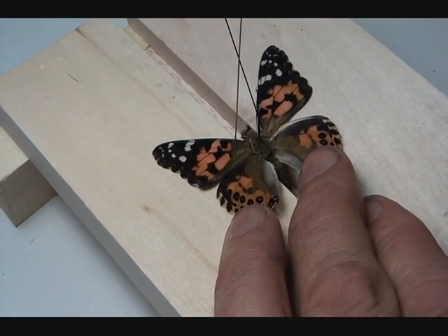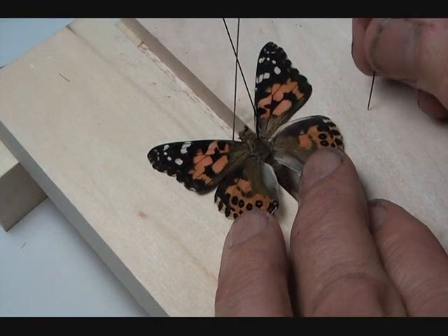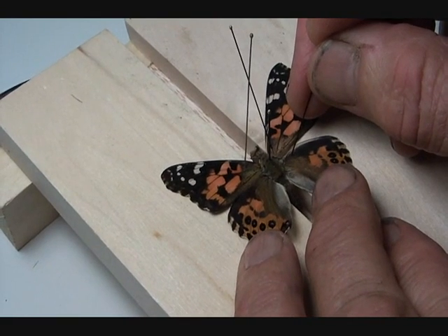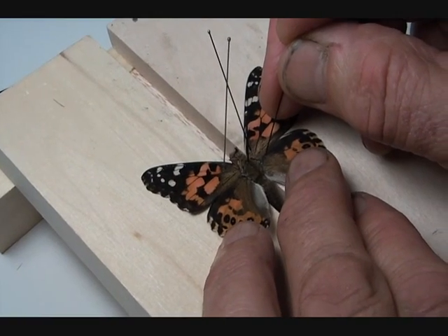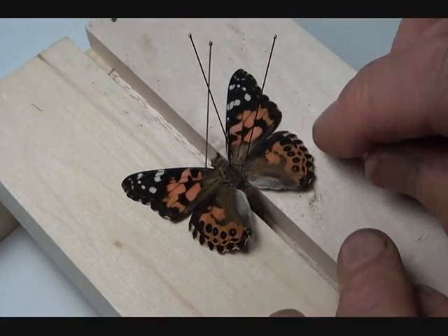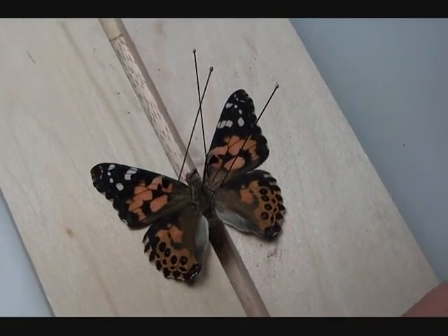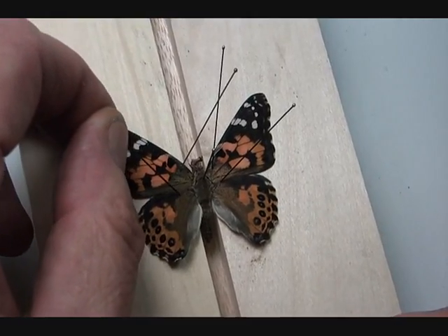Be careful not to pull out the hind wing completely because you want it to slip under the forewing. The hind wing should be brought forward — there isn't a very strong vein there, so pick something that fits. Bring it forward until there's a gap but not a narrow V-gap. It's actually perfect on the left side. Then anchor that.